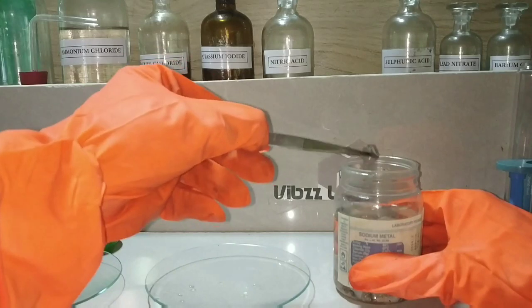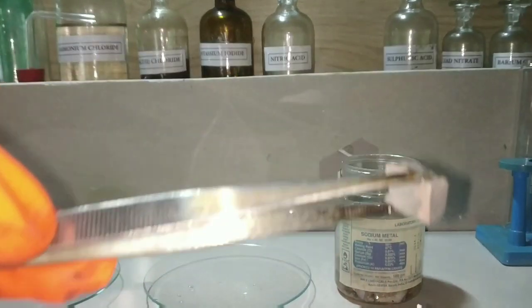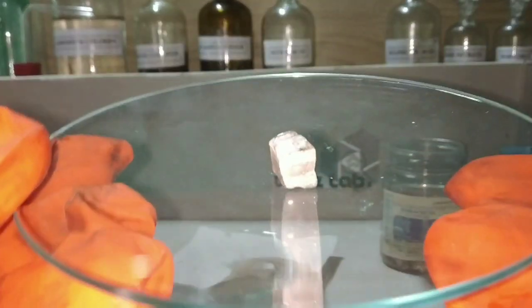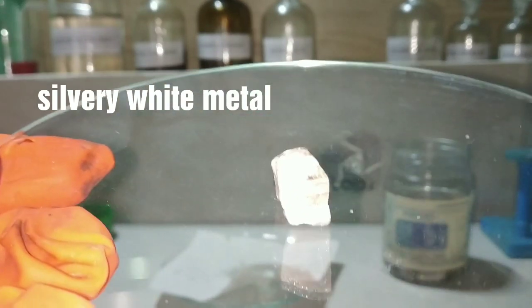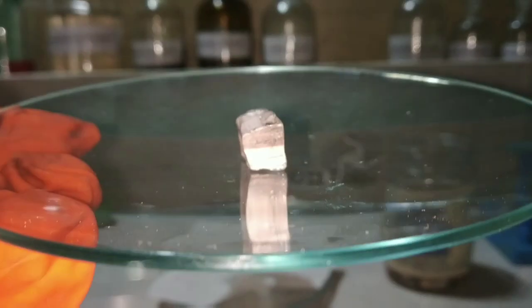Sodium metal, as any other alkali metal, is a silvery white and very soft metal which is highly reactive. Here you can see this is the sodium metal, which is silvery white in color, but you can see a bit of dullness here and there. That is because of the oxidation.